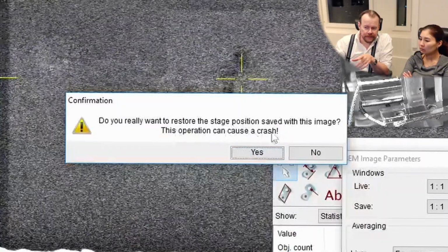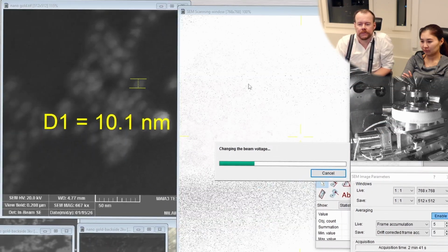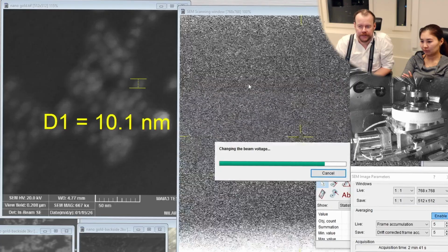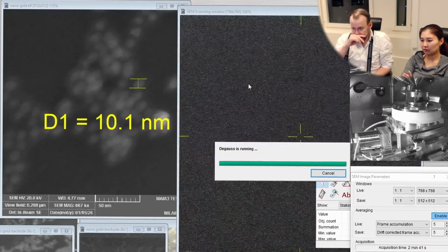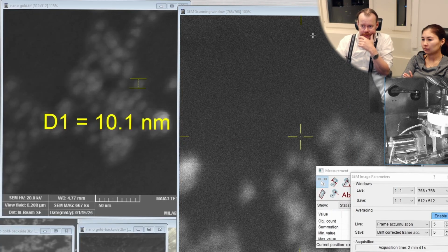And it says this is a risk, it can crash. So of course, you cannot load the image that you took yesterday because you must have the same sample on the same position. So you can only do this during the same session, so to say. But it is a nice tool when you want to revert back to a previous place. So it brings it to the exact same place? Yes. Now this was at the highest magnification, so it might be a little bit offset since the stage will be moving. Yeah. But we will see where we end up.